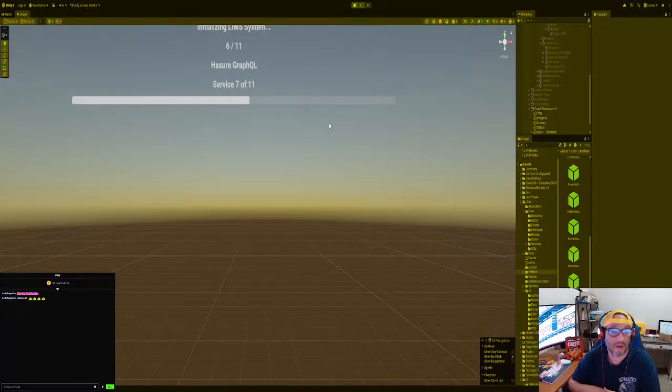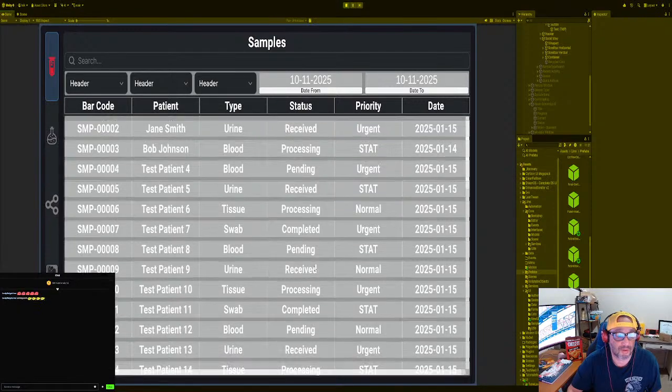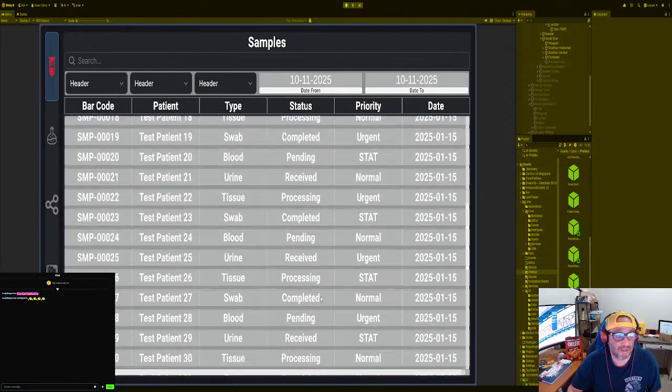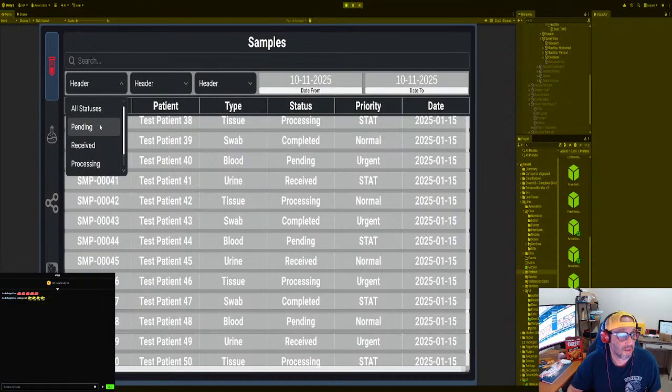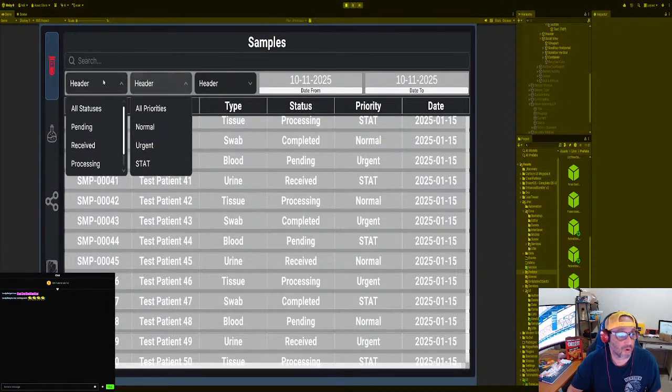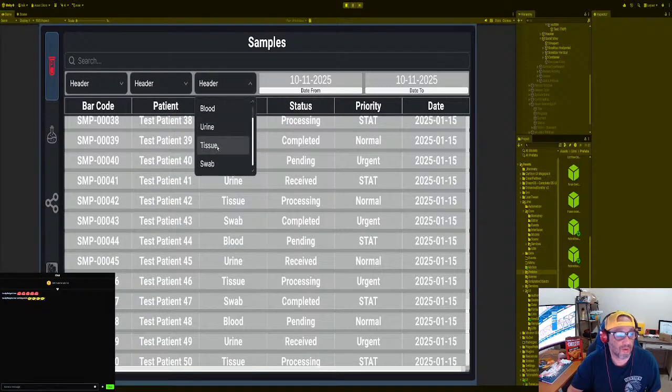Okay, we got our bootstrap system working, and there we go. And this is the actual game screen, right? And you can actually see all the data coming in and out. So we are gonna adjust these, make these workable, and then we're gonna add all types of urine, tissue tabs. Of course, it's gonna be a lot more types than this. We're just doing this for brevity and for testing.